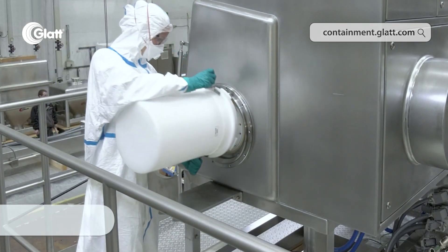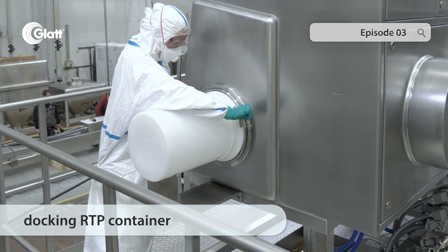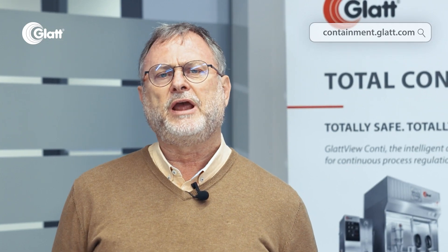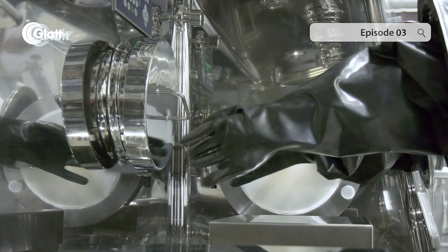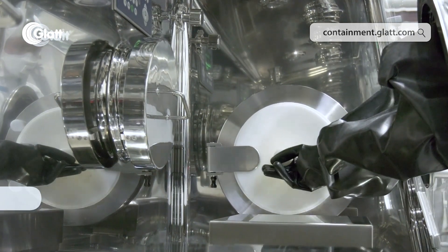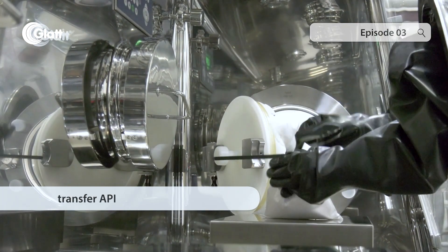When smaller quantities must be handled, the product enters the isolator via the so-called RTP ports. These are doors in the isolator wall that are actually just one half of a door. The other half is on the container, and only when these two halves are docked together and locked do they act as one door, which can then be opened from the inside of the isolator.